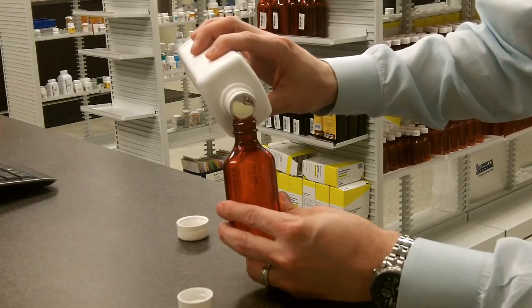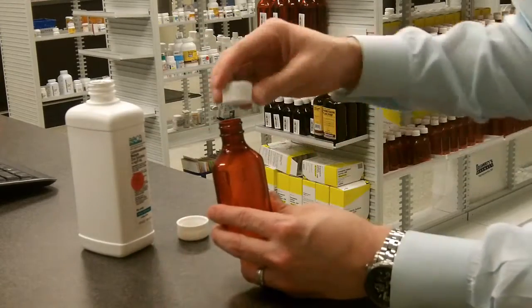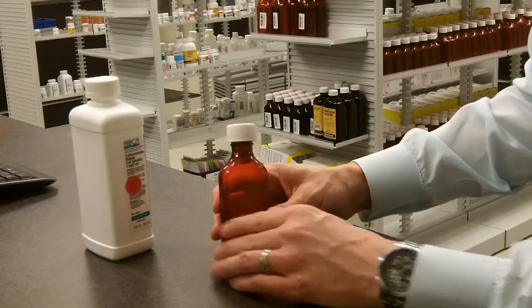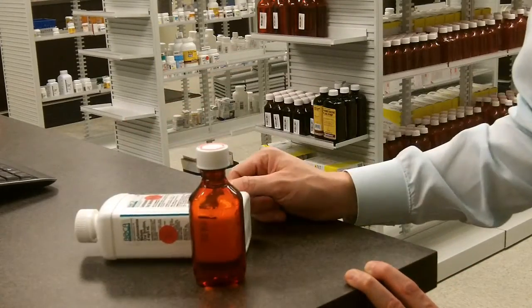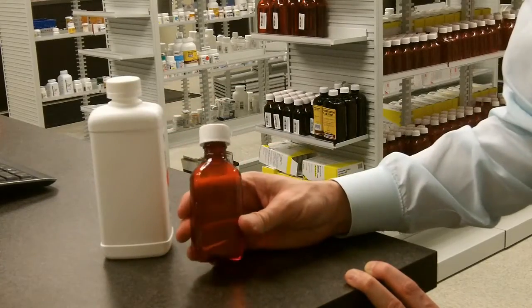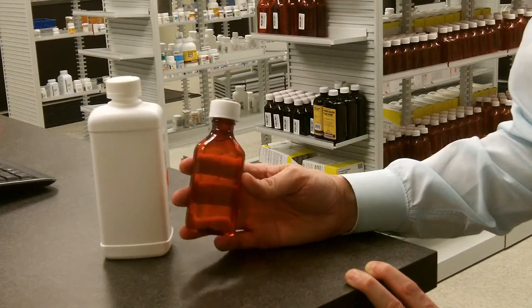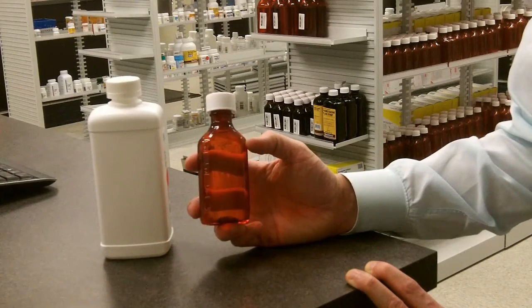Now that I'm close to the top I'll just go nice and slow until I get there. And voila — just like that, I have a four ounce bottle. You want to make sure with liquids that you close the cap as quickly as possible so that you don't spill everything. Keep everything closed as quickly as possible so you can dispense the bottle without any big clean up. At some point in your pharmacy career you'll mess that up, and no one looks forward to that day.